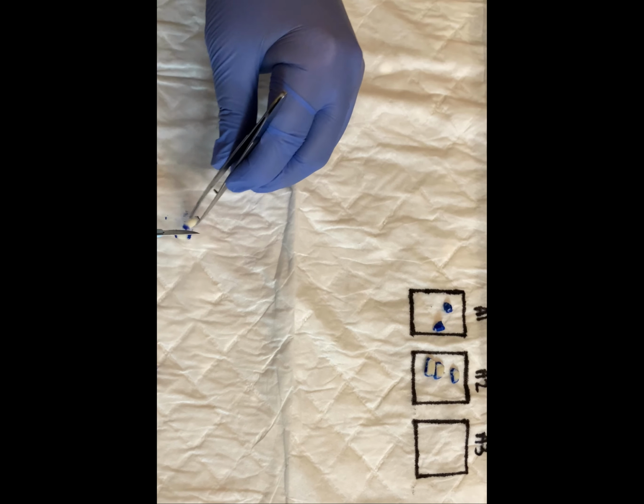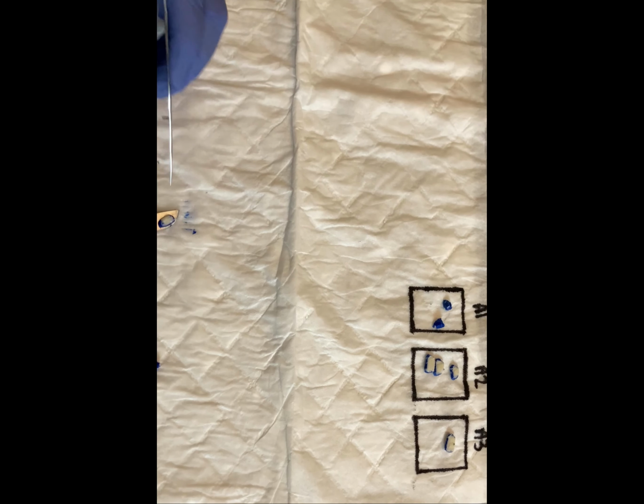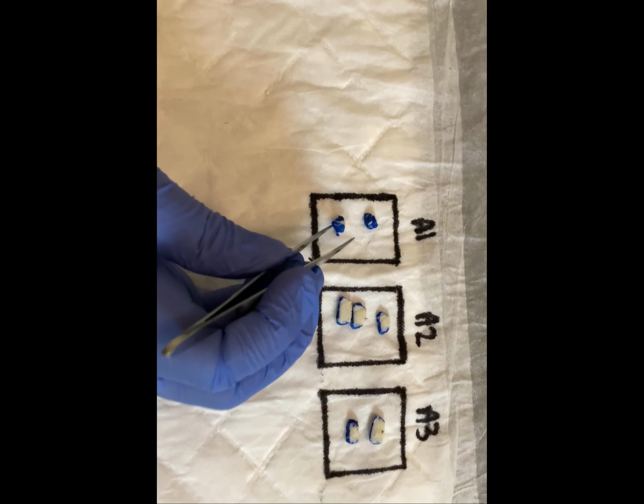Notice that each section is cut thin and demonstrates both skin surface and margin. The margins are crucial in skin ellipse specimens, as this is what the pathologist will be evaluating in order to determine clearance of the specimen. At this point, we have completed the grossing of the specimen and can move on to generating the dictation for the specimen.